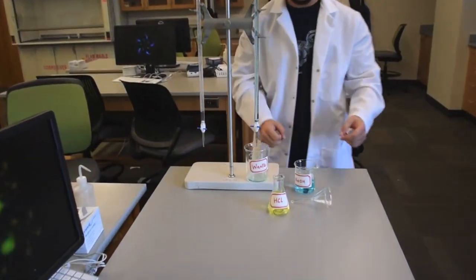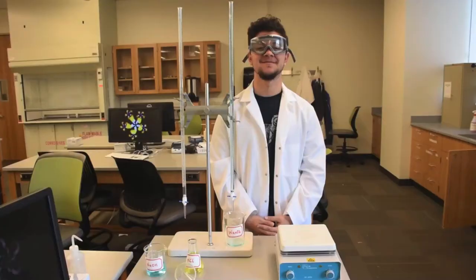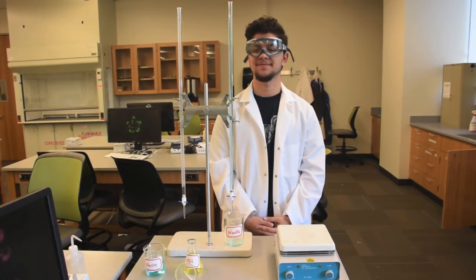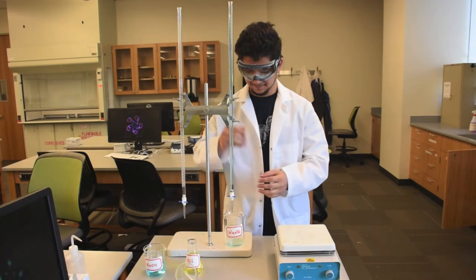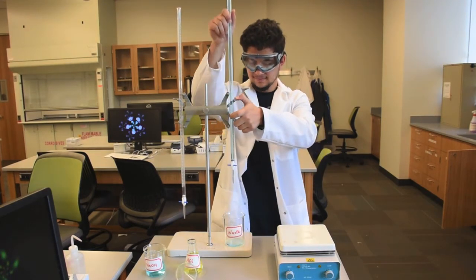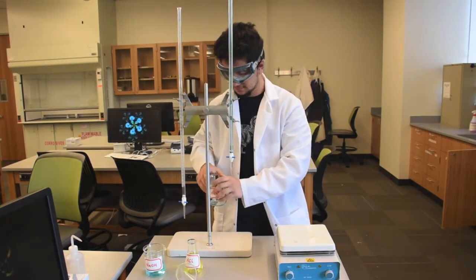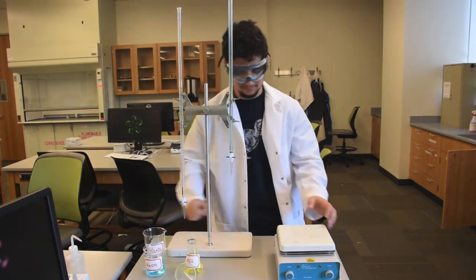Upon reading the initial burette volume, adjust the burette height so that there is ample room underneath the burette to place an Erlenmeyer flask with a stir pad underneath it. You may have to adjust the height again to avoid any splashing when dispensing the titrant.